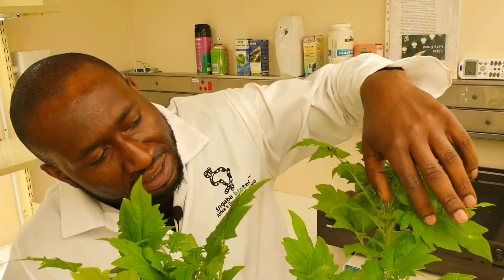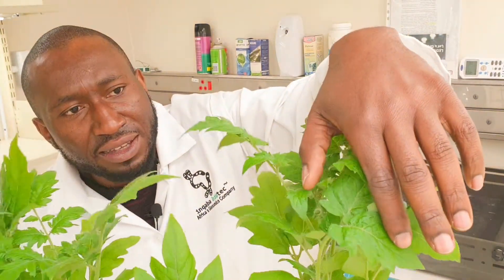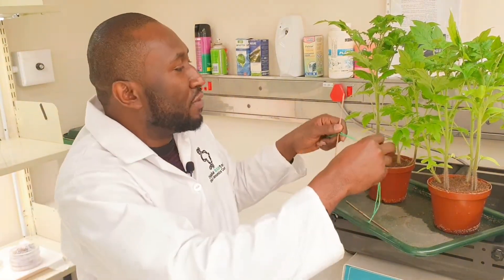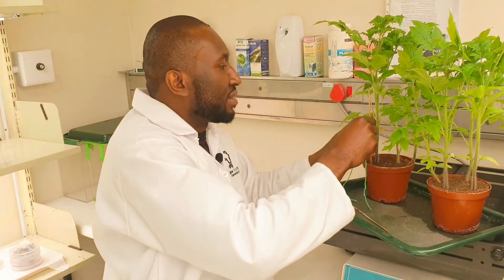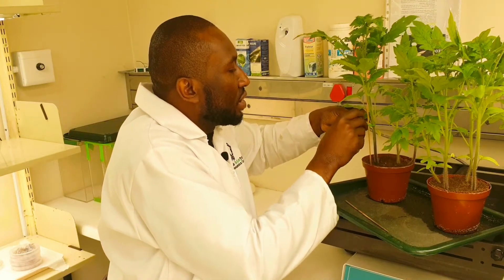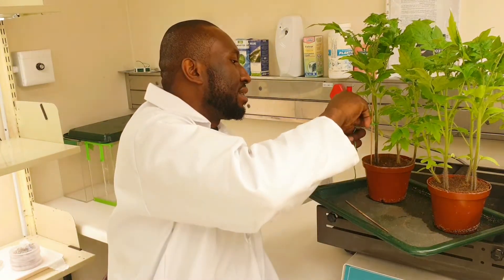If you look here, you will see it's about to flower — the flower is about to come out here. This plant is getting matured. When they are growing out of hand, in order to keep the plant growing vertically, I use a wooden stick and tie it with wool to make sure it keeps growing vertically.